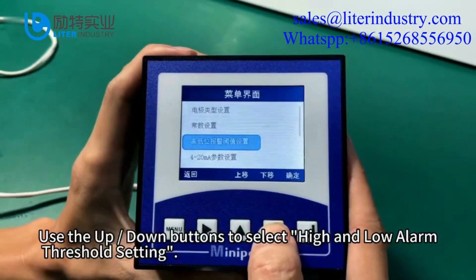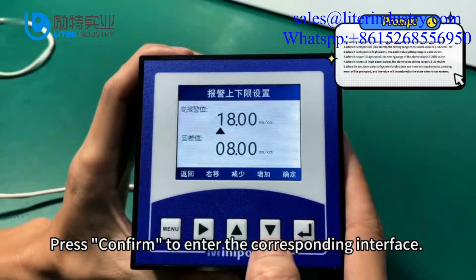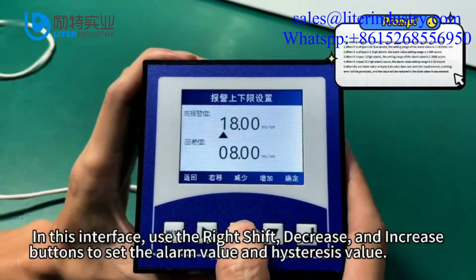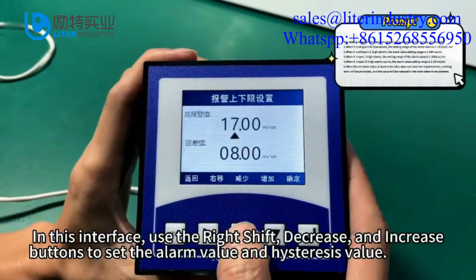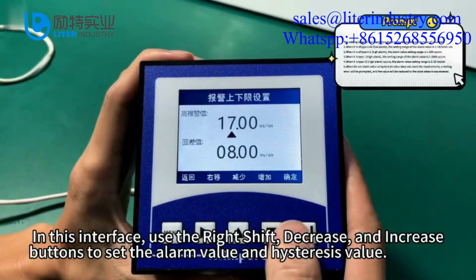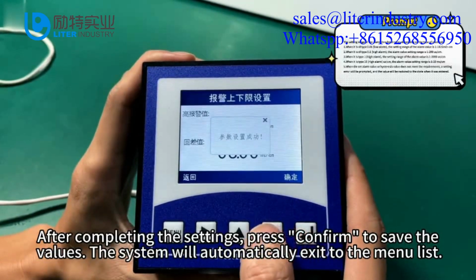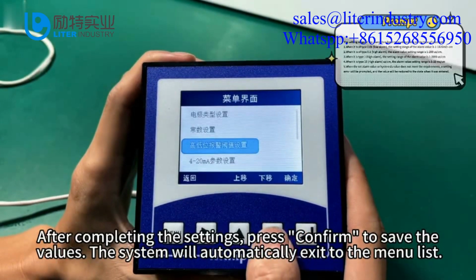Use the up-down buttons to select high and low alarm threshold setting. Press confirm to enter the corresponding interface. In this interface, use the right shift, decrease, and increase buttons to set the alarm value and hysteresis value. After completing the settings, press confirm to save the values. The system will automatically exit to the menu list.